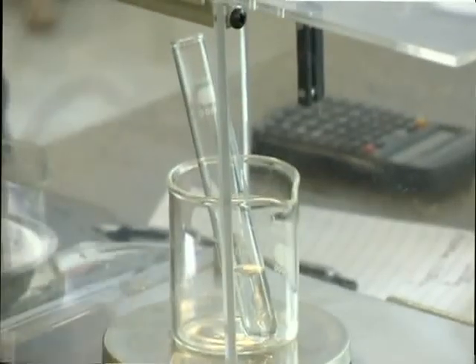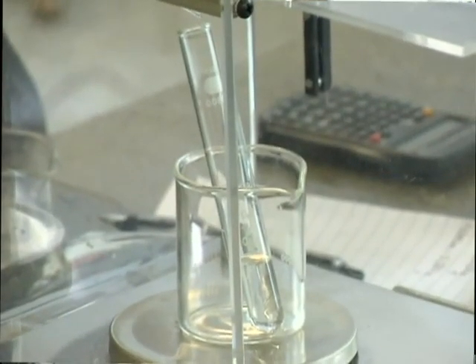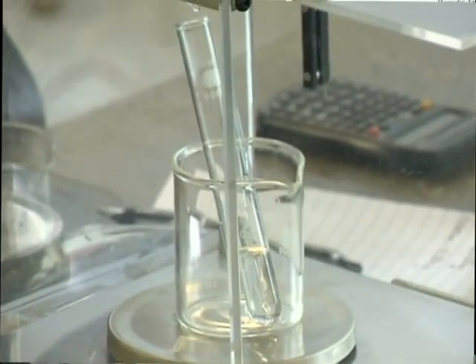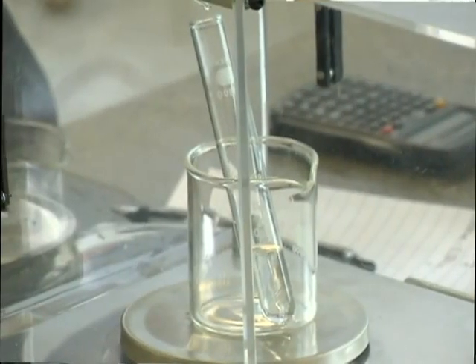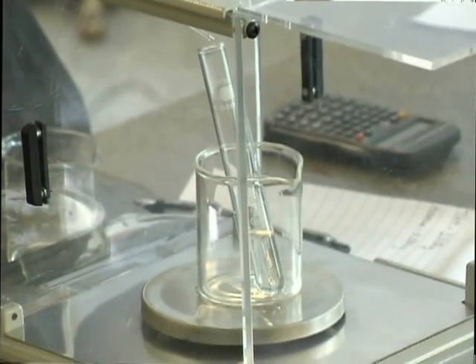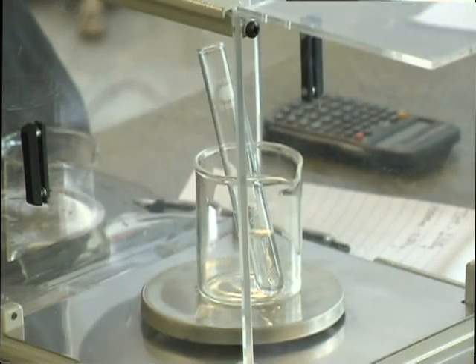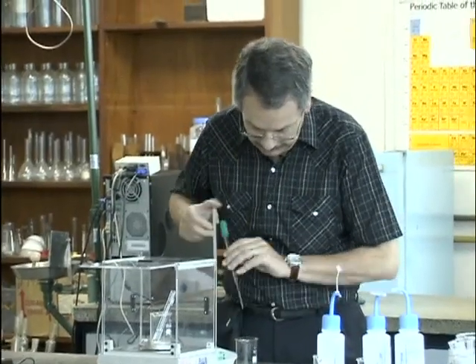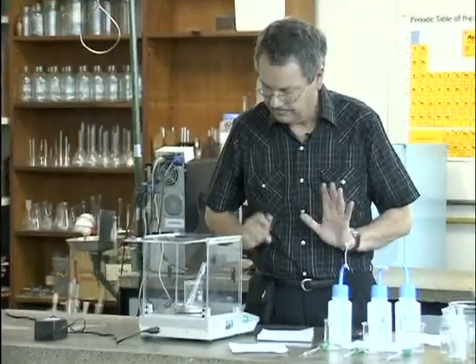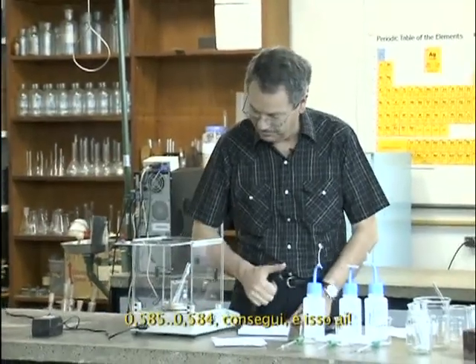So 0.584. 0.585. 0.584. I got it. That's it.